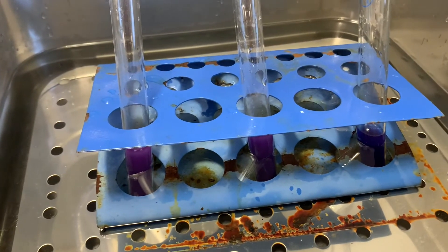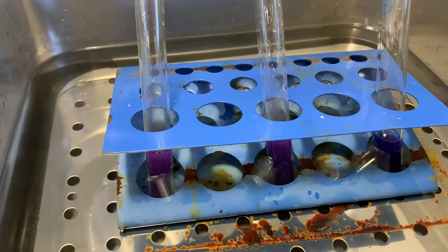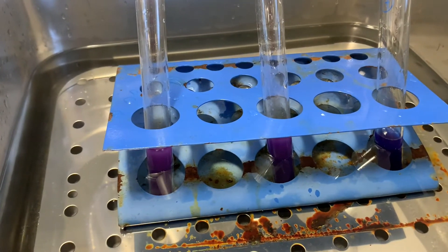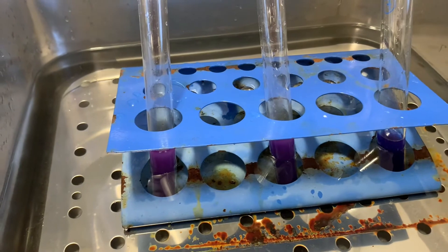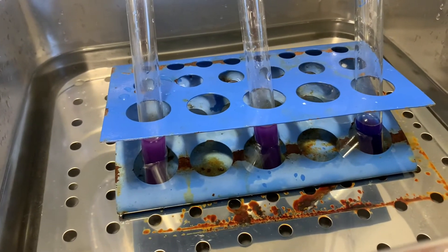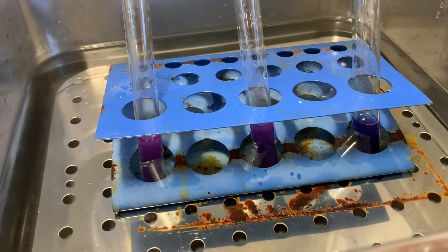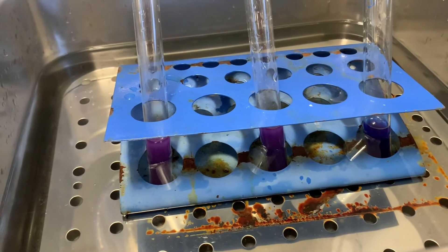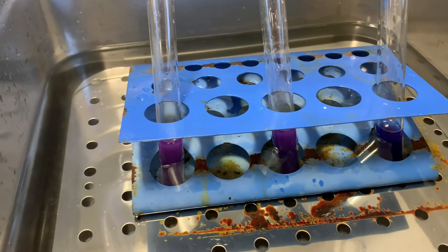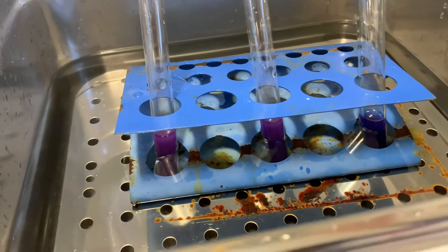As you can see, test tube A is starting to have a color change — it's slightly lighter in color than the others. We're at 1 minute 25 seconds on the stop clock. You can see that kind of color change happening; it's gone from a dark blue and is just starting to look like a lighter purple.